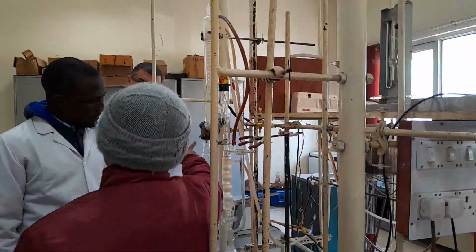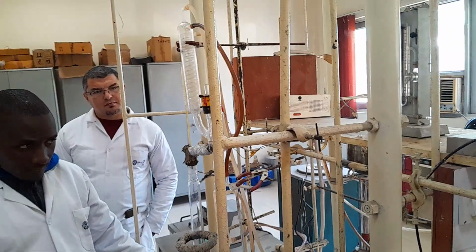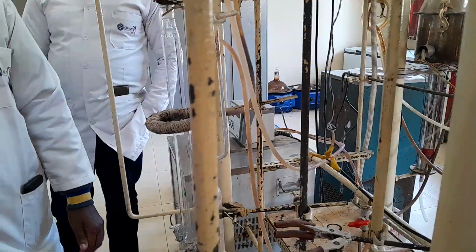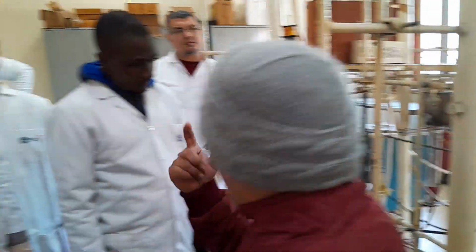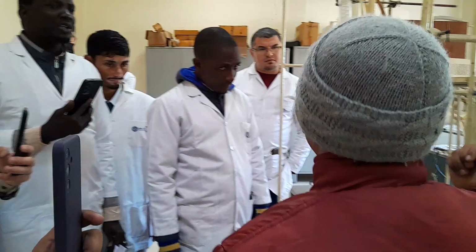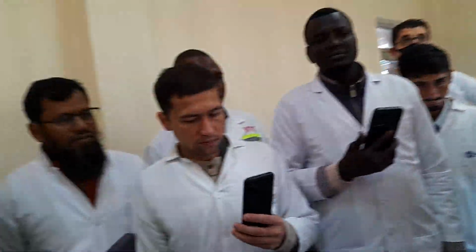If the IBP by fractional distillation is 20, then the IBP of the same sample by D86 will be either 30 or 35. The difference between these two IBPs may be 10 to 15 degrees centigrade. The reason is that this is fractional distillation and that is non-fractionating distillation. That's on product.